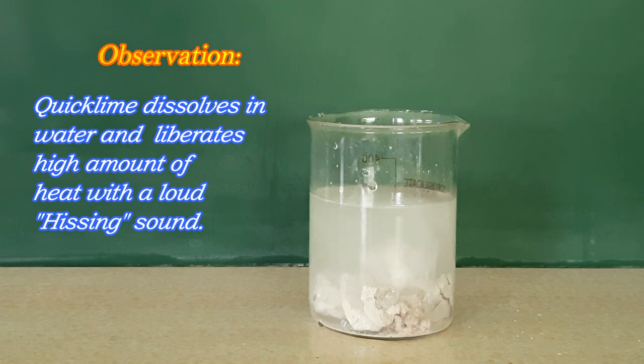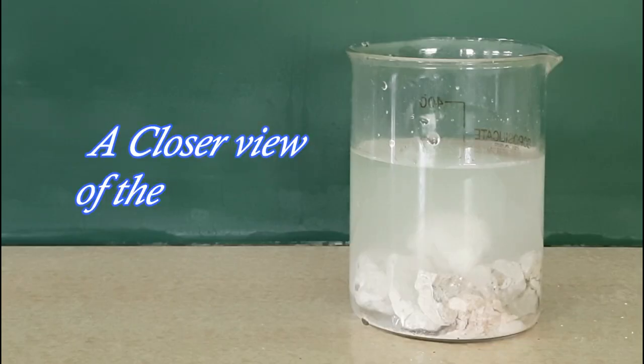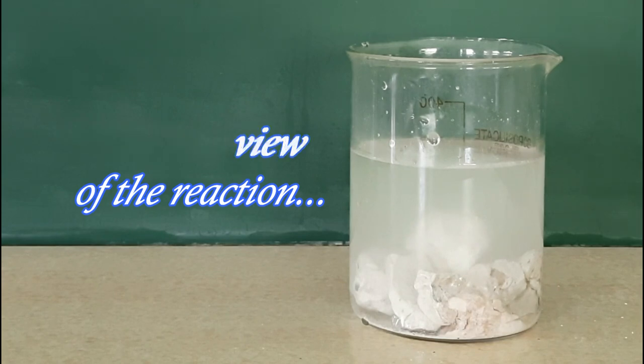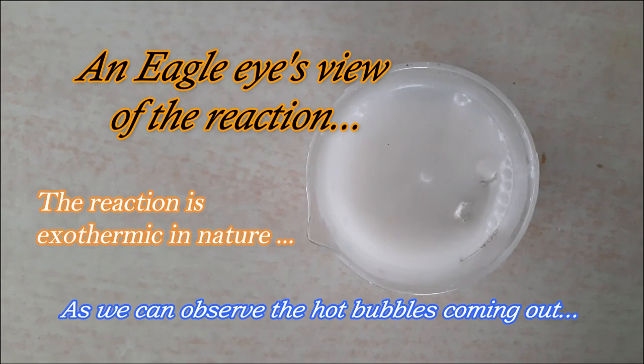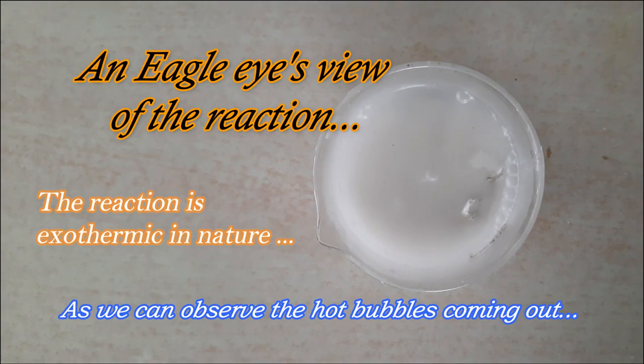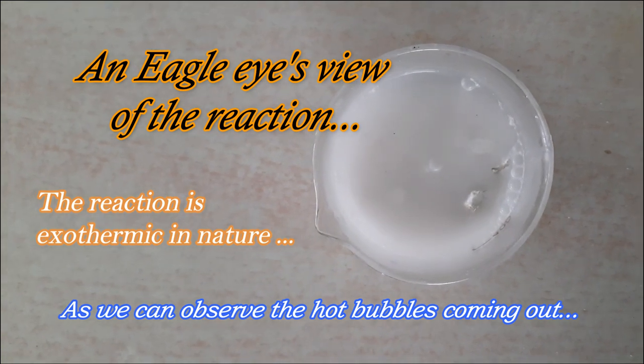Quick lime dissolves in water and liberates high amount of heat with a loud hissing sound. The reaction is exothermic in nature as we can observe the hot bubbles coming out.